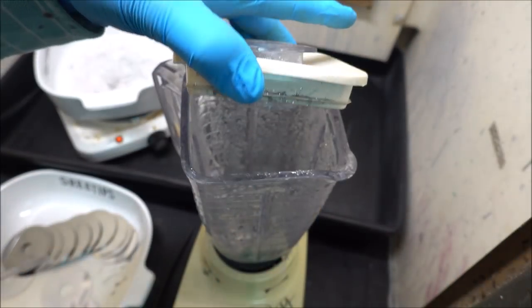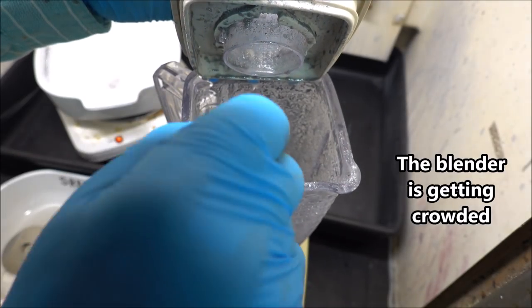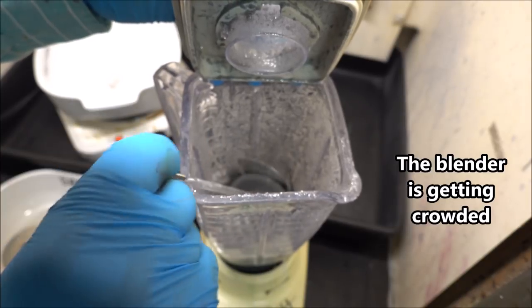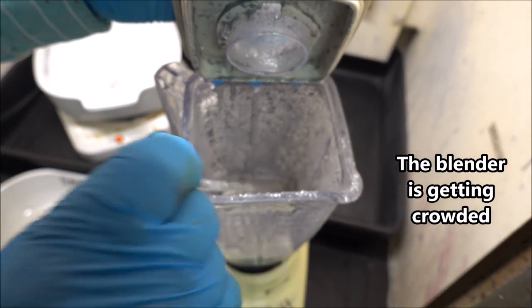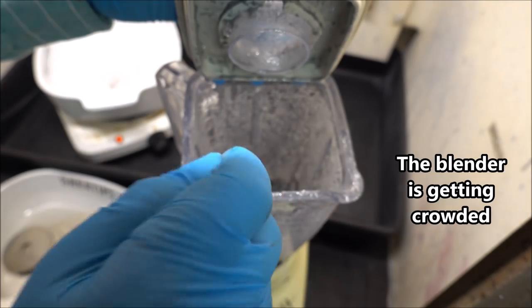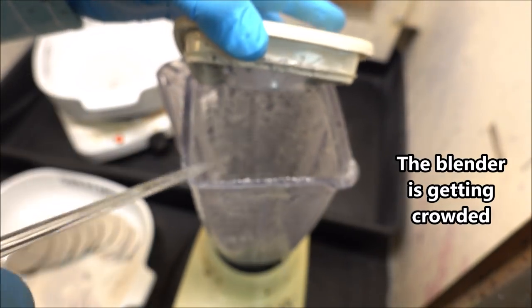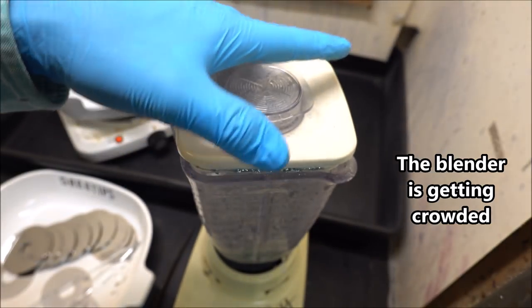It's not going as smoothly as I thought it would. It's working, they're grinding up, but you gotta pick it up and shake it and move them things around continually before they'll get ground up into a fine powder like I wanted.